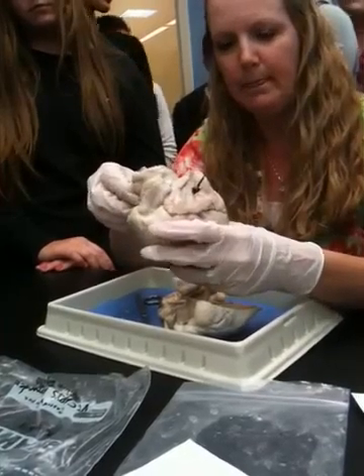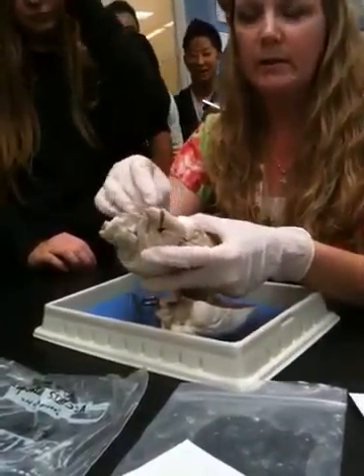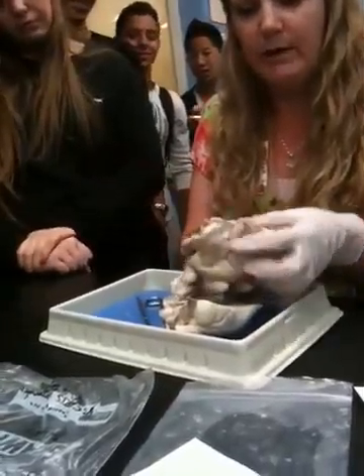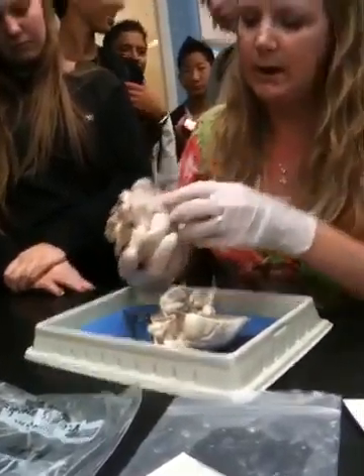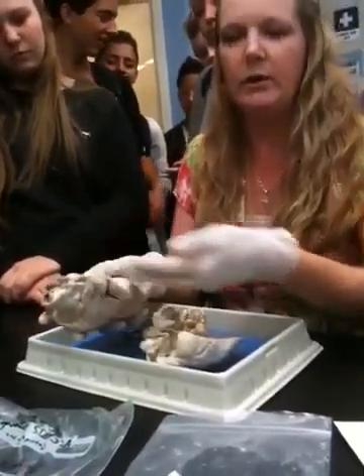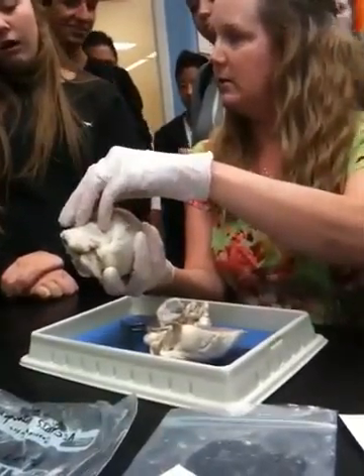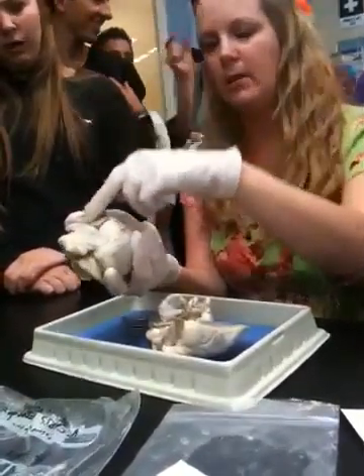All right. And on the other side, you can't really see the other great vessels, the pulmonary veins, because of the way that it was cut out of here. On this one, they would be right over here, wouldn't they? But it's totally cut off, so you can't see it. It would go right into this, which is the inferior? No, wait.